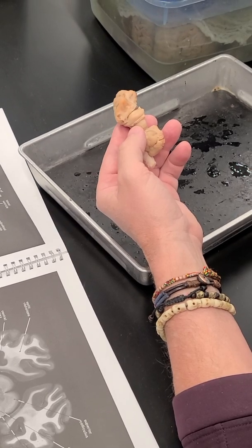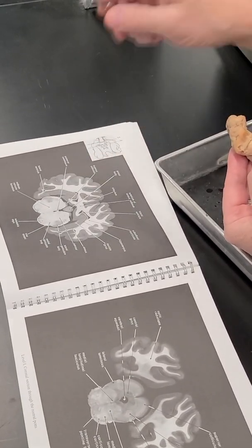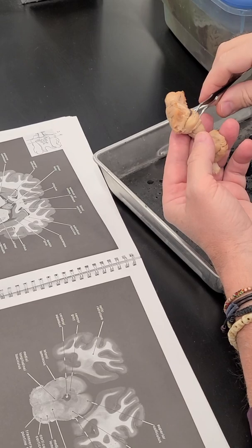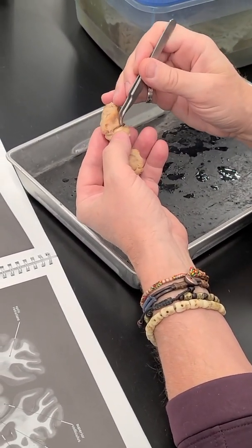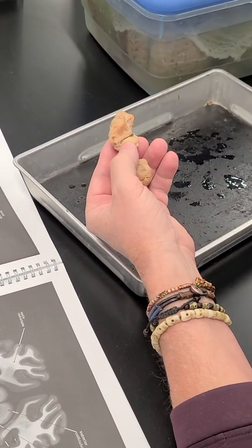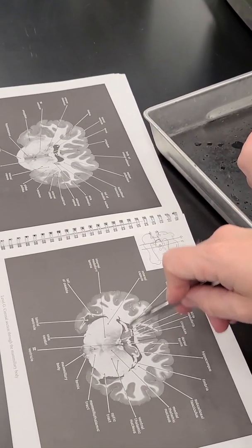And I don't know if they have that labeled in here, but that's this white layer that you see right along the surface. And that is the axons that are coming into and going out of the hippocampus, and that collects cranially or rostrally to form the fimbria. And so this band at the rostral end of the hippocampus, or edge of it, is the fimbria. And they do have the fimbria labeled in several locations on these slides. It's this big band of white matter here.